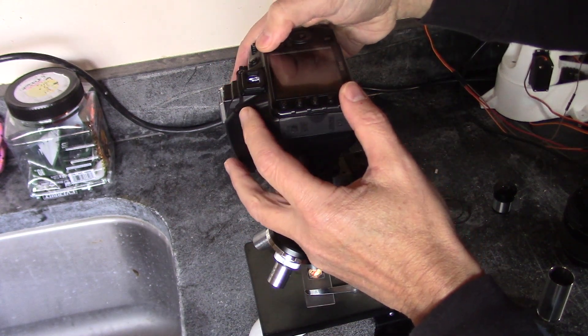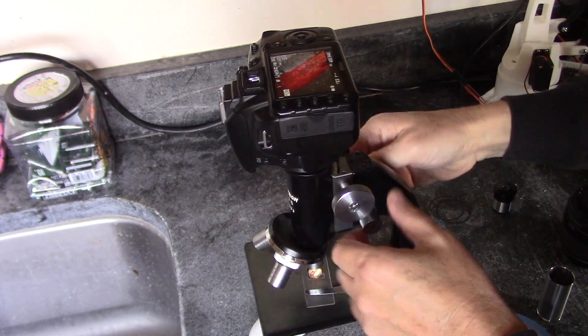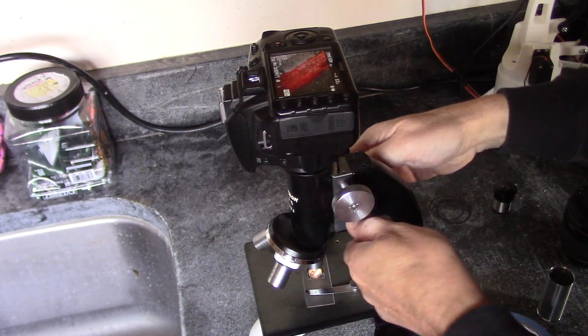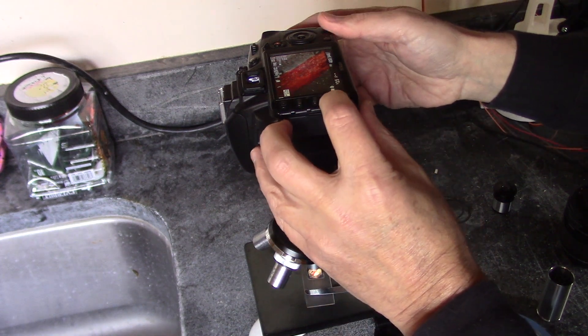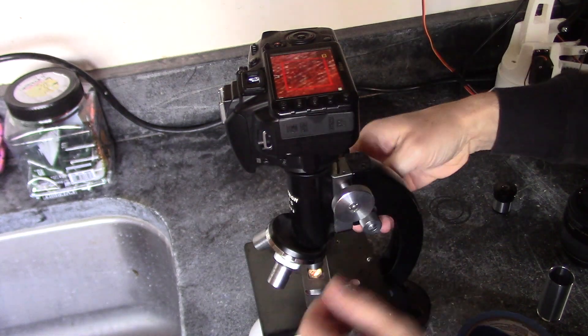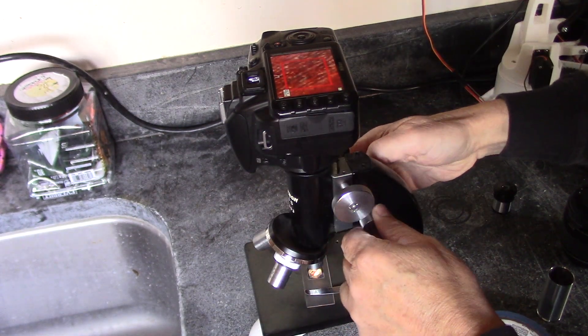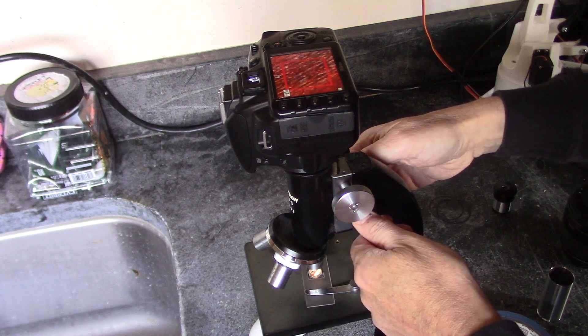Okay, now I've got a timer, all of these DSLRs like this have a timer, and okay, now what I can do, I can zoom in and see how well that focus is working out, okay, all right, let's try that.